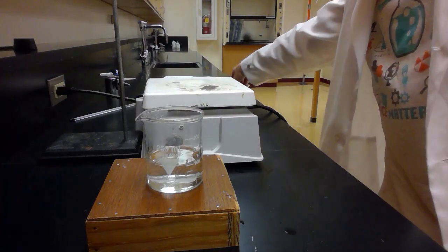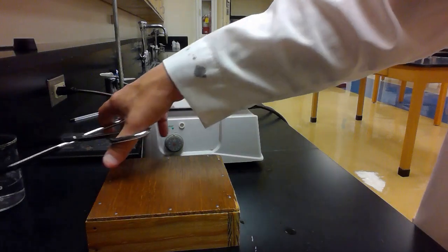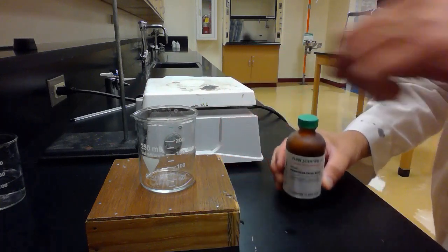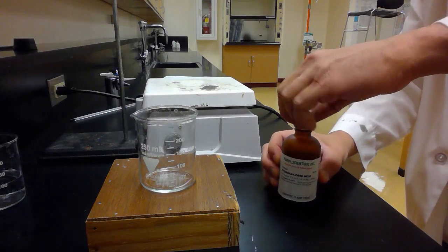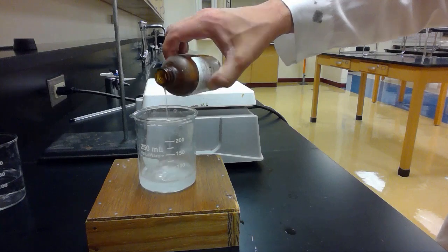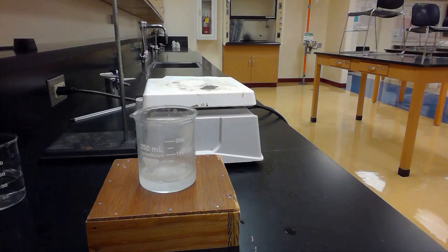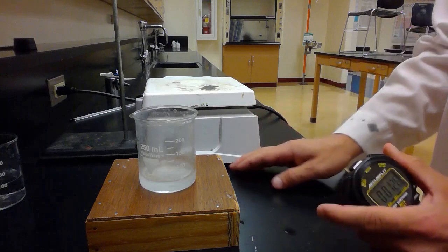Alright, and then the other fun one, let's take a look at. Let me move my boiling hot water here. I have some concentrated hydrochloric acid. So this is hydrochloric acid that is very concentrated. I'm not going to put all that much in here. Let's just put about 50 milliliters. I got a yellow one, so let's see. How long does this take if I don't drop it?